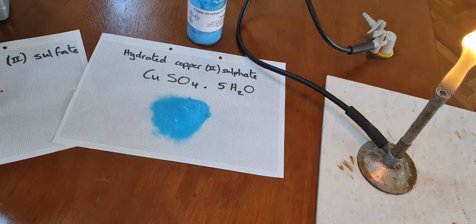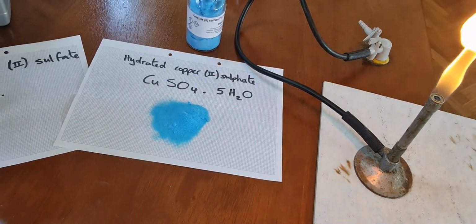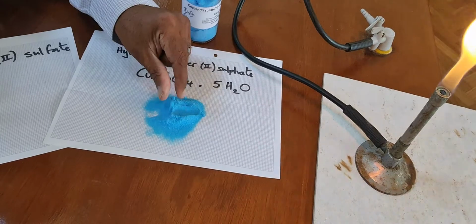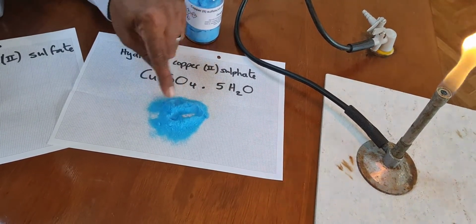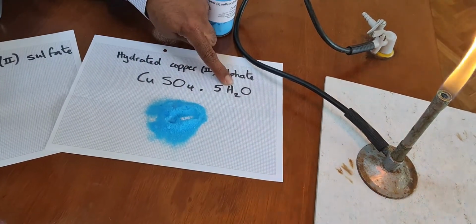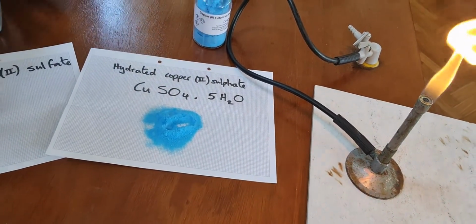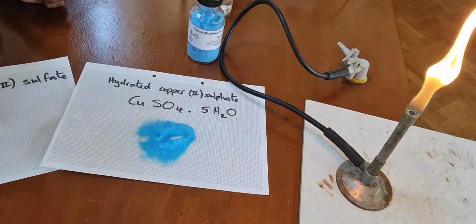And it's blue because copper ions with water give that blue colour. So within those crystals, I mean, that's dry, that's not wet. These crystals, there's water trapped inside, and that trapped water is water of crystallization. It's that water there. The .5H2O, the formula CuSO4.5H2O, the .5H2O represents the water of crystallization.